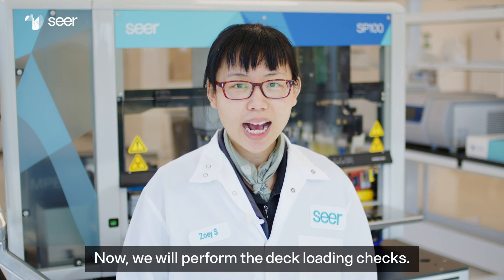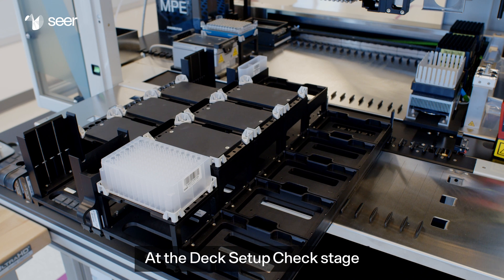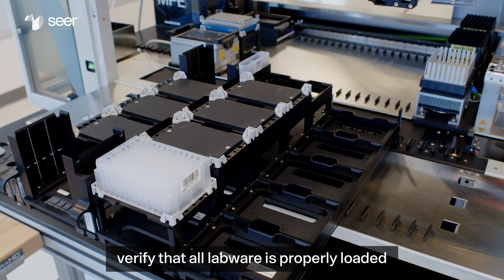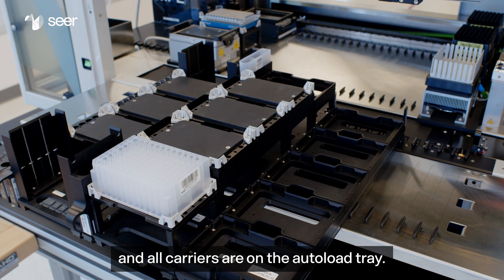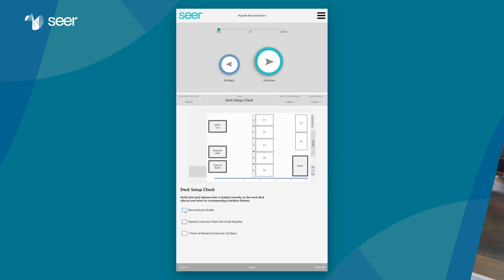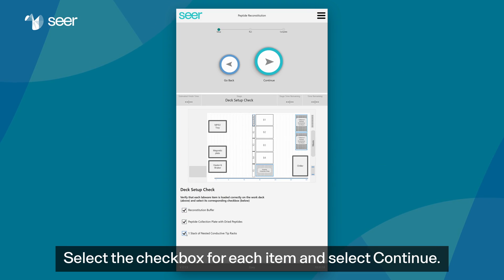Now we'll perform the deck loading checks. At the deck setup check stage, verify that all labware is properly loaded and all carriers are on the auto load tray. Select the check box for each item and select continue.